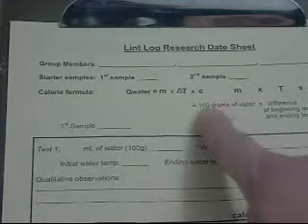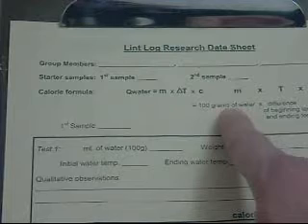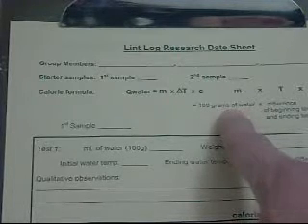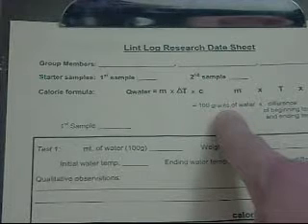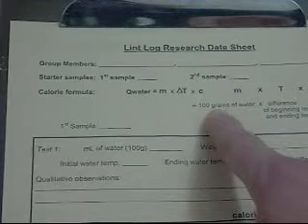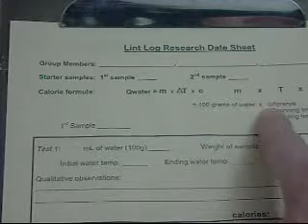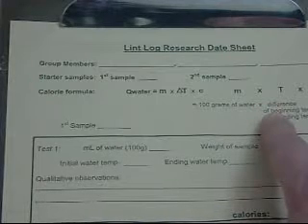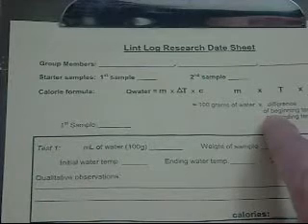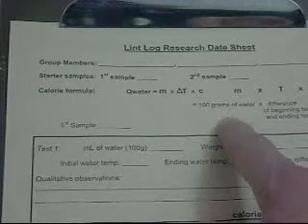We are going to be measuring out 100 grams of water. 100 grams of water is also equal to 100 milliliters of water. I'm going to be testing you on that, so please remember, 100 grams of water is equal to 100 milliliters of water. The difference of the temperature is going to be the difference from the beginning water temperature till the end. Okay? So we'll be using this together in class.